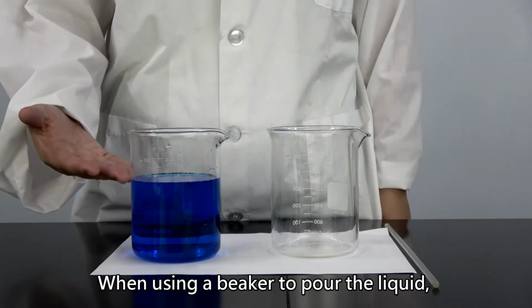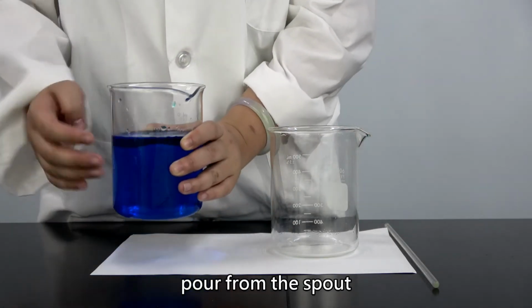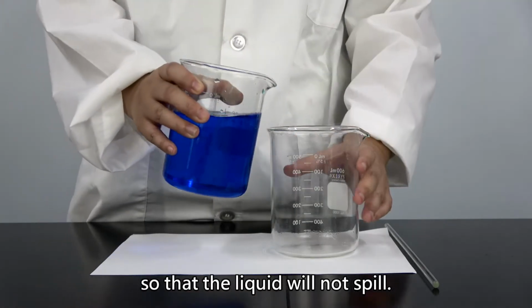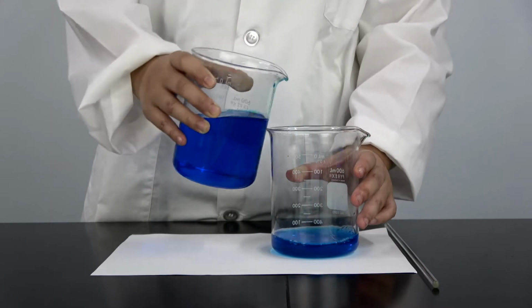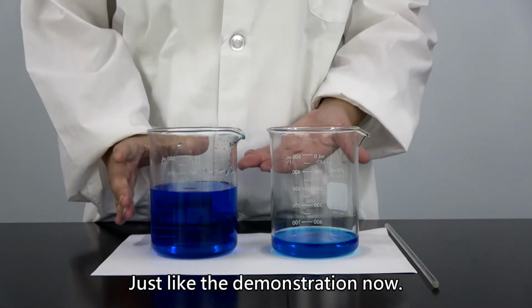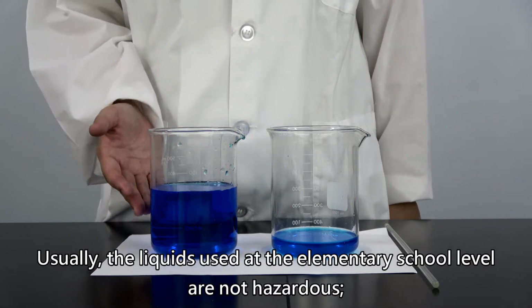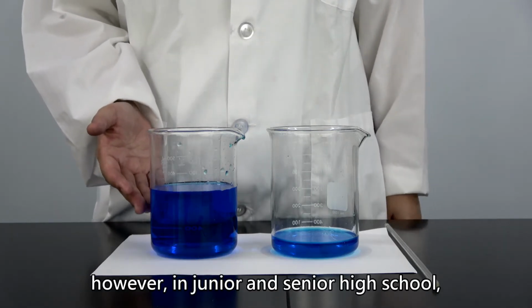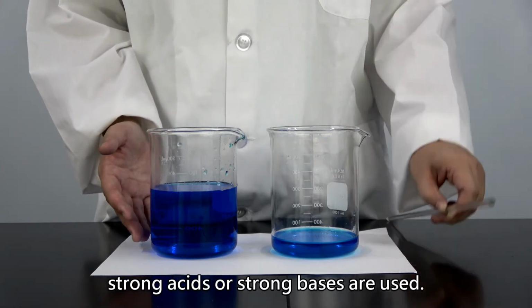When using a beaker to pour the liquid, pour from the spout so that the liquid will not spill. Just like the demonstration now. Usually, the liquids used at the elementary school level are not hazardous. However, in junior and senior high school, strong acids or strong bases are used.